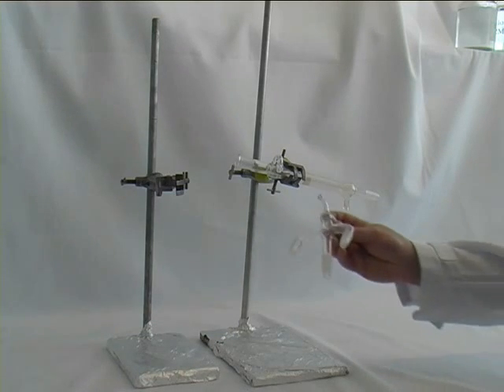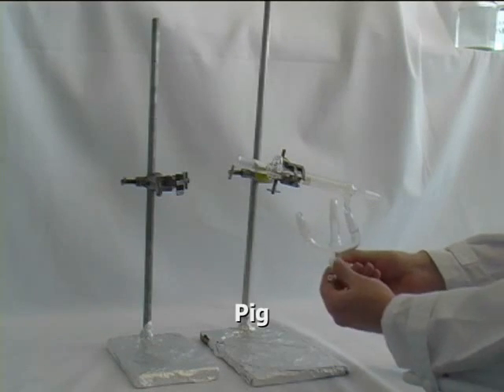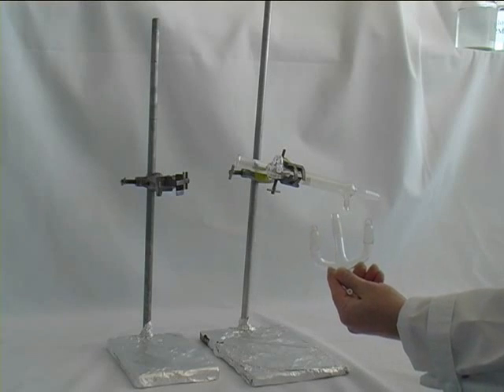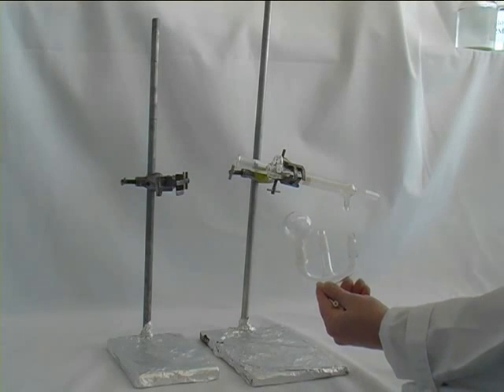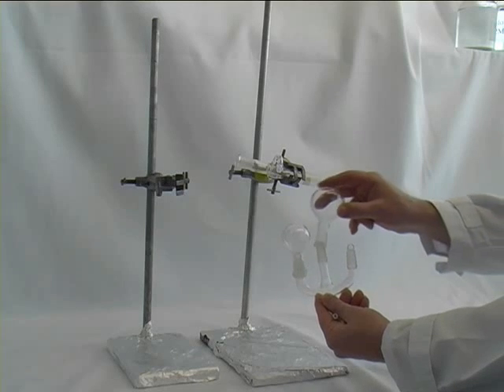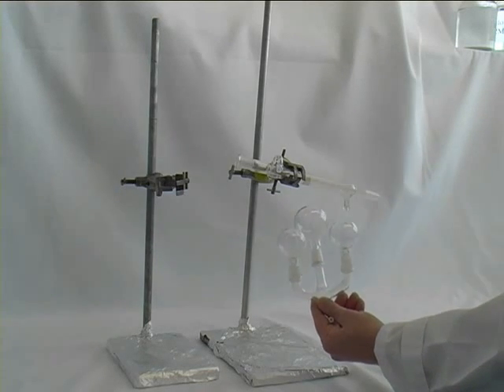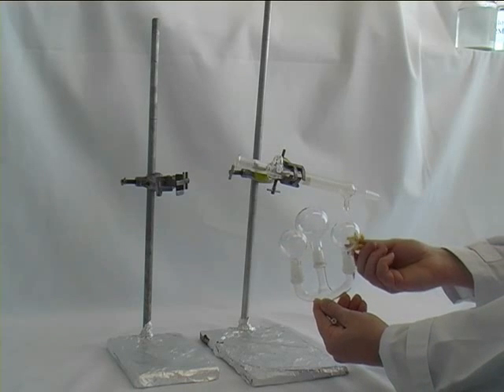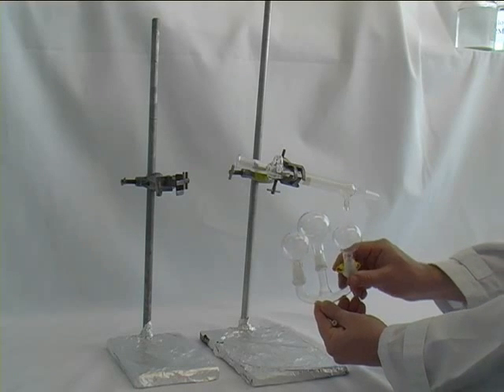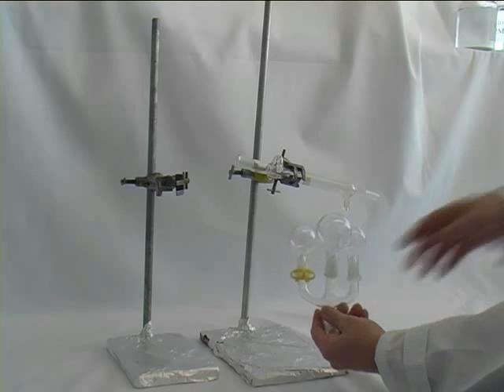The next important piece of equipment is the so-called pig, which allows us to collect different fractions. You have provided those round bottom flasks that you put on, and you will secure all round bottom flasks with yellow joint clips, which prevents them from falling down.